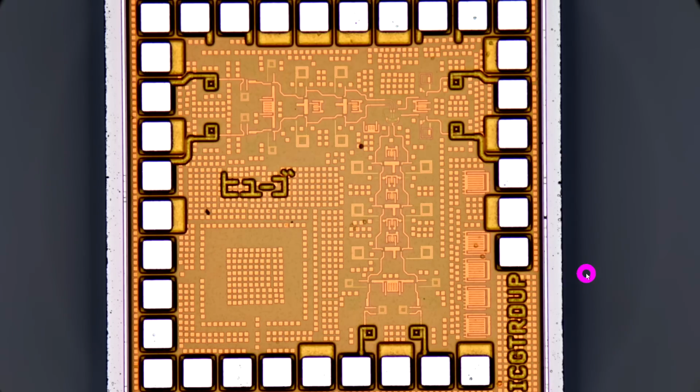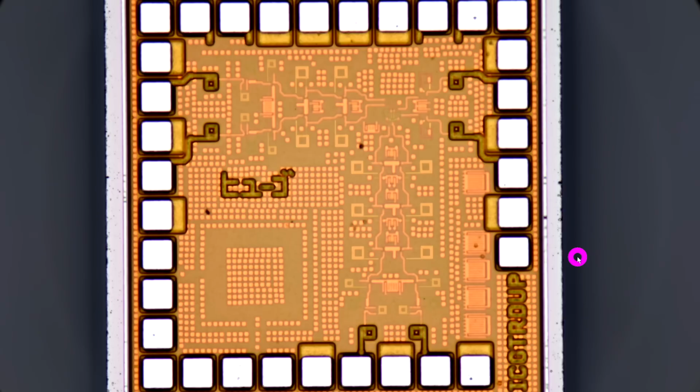As you can see, we have multiple metal layers, as is common with these technologies. This is a 0.13 micron CMOS technology, if I'm not mistaken. Now, if I go all the way up to the top focus, you can see that I can focus on the pads, and I can focus on the text at the very top layer. As I go further down, the focus plane moves further in towards the bottom layers, and at some point, the bottom metal layers are the ones that are in focus.